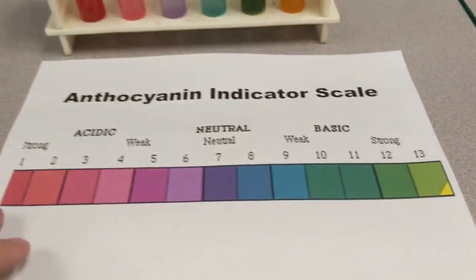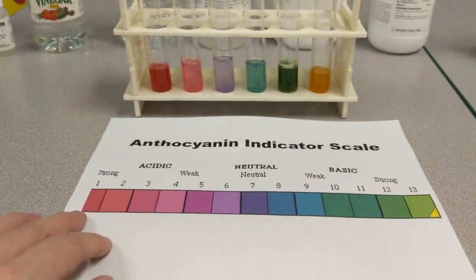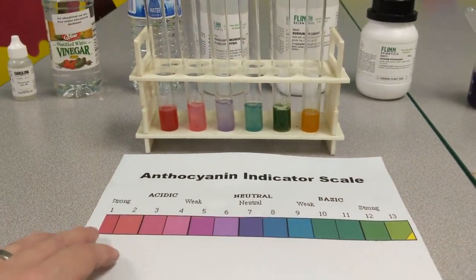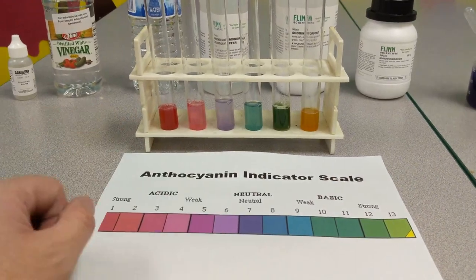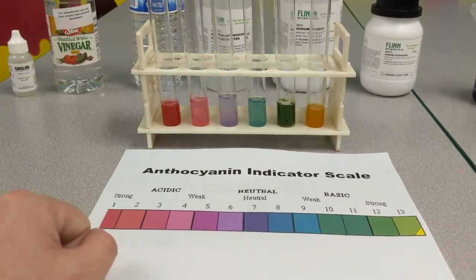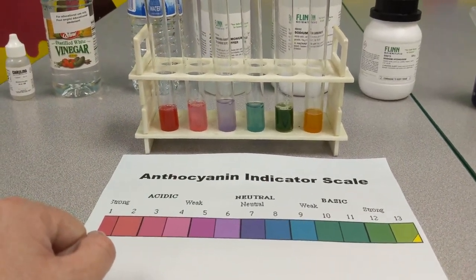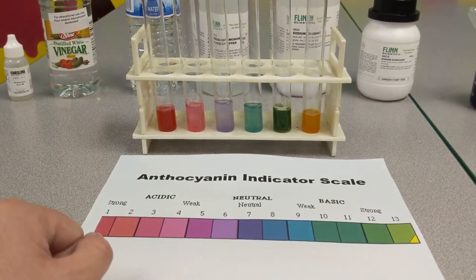So let's show the range again right here — you can see the differences. This is anthocyanin being used as a pH indicator.